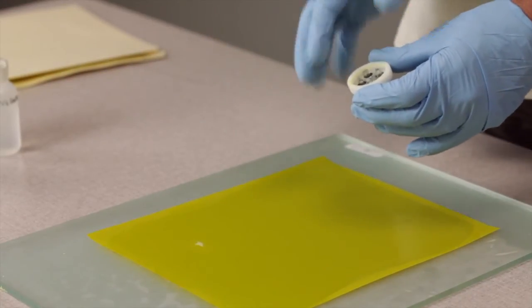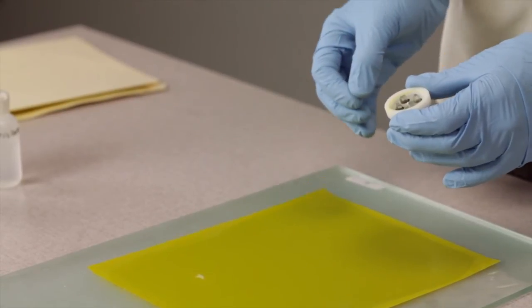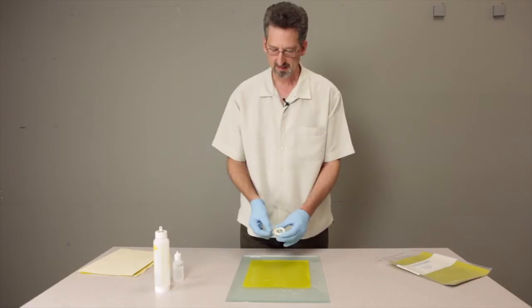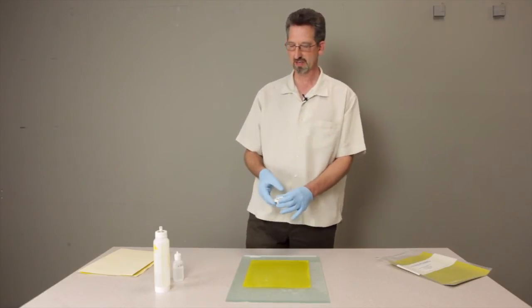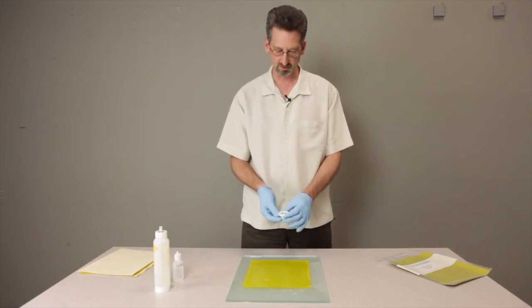At this point, we'd wipe the sample clean with some cotton padding, lithographer's pad, and then go to the next stage. If you're lucky enough to have a microscope nearby, you can check to see your progress.